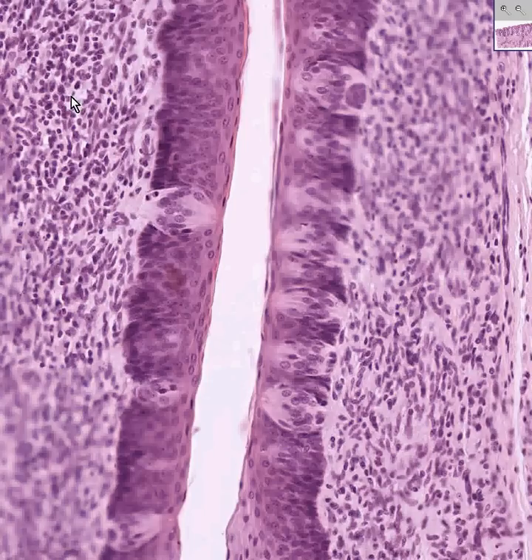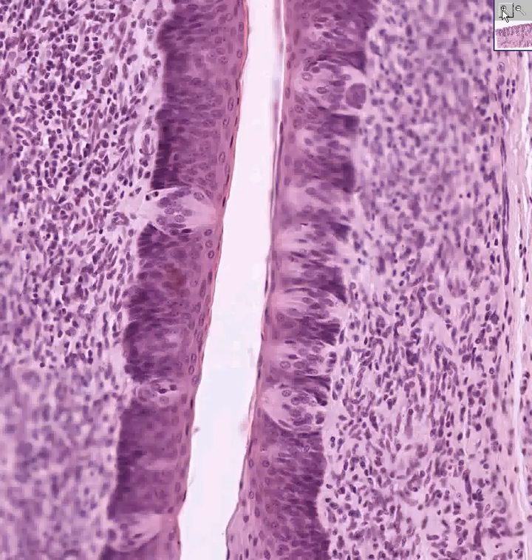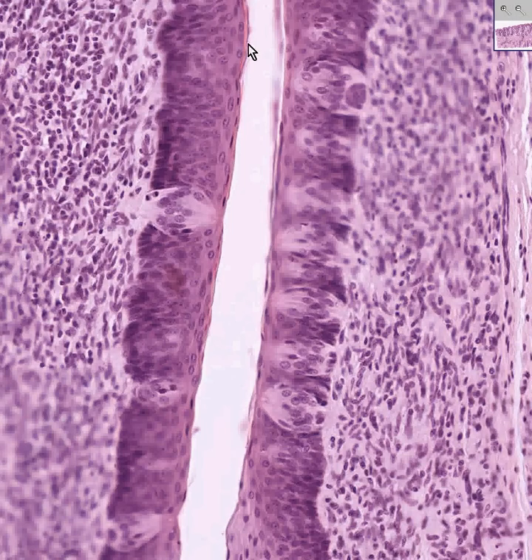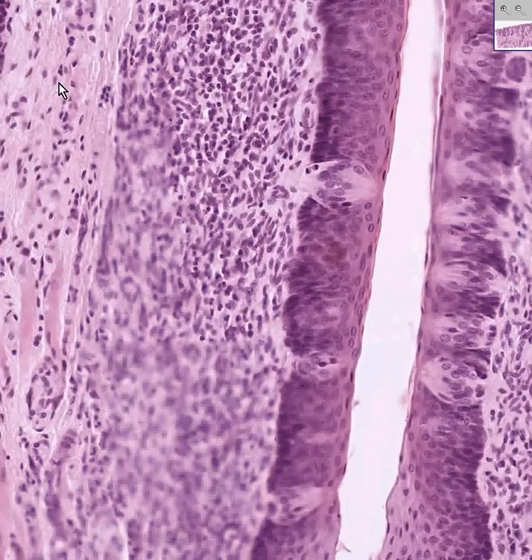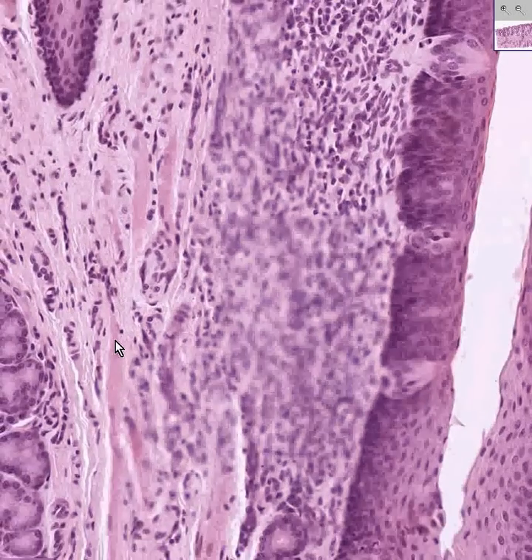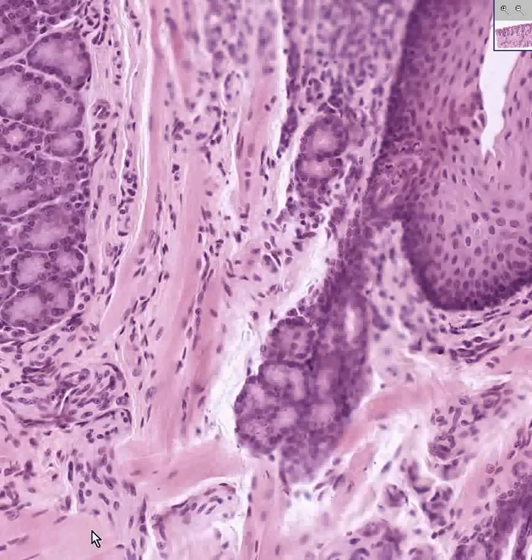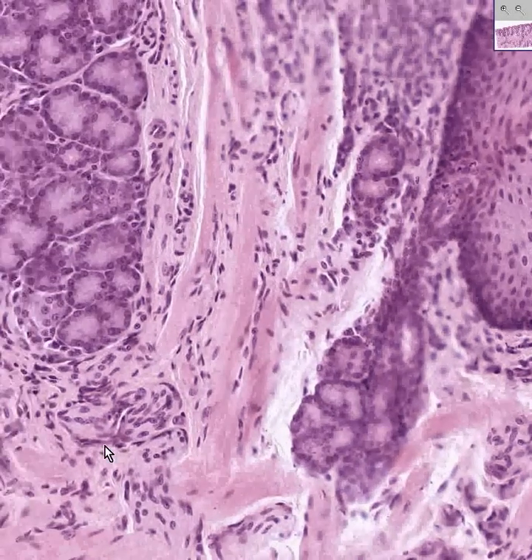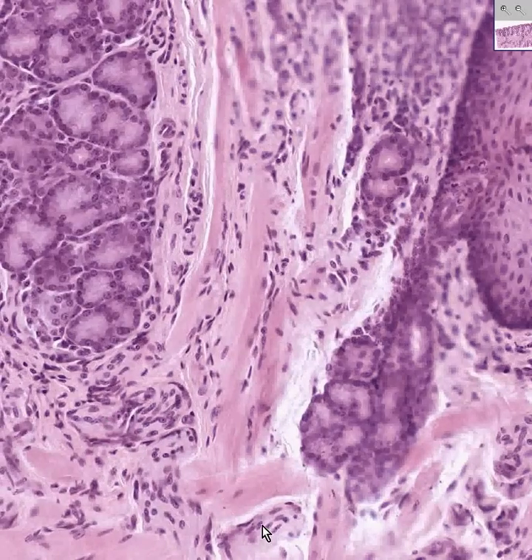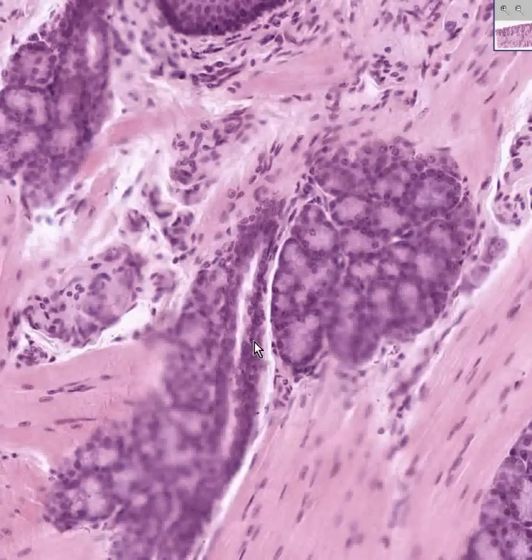Here's some lamina propria connective tissue — it looks like there are fibroblasts and lymphocytes, perhaps mucosal-associated lymphoid tissue or MALT, perhaps some plasma cells and macrophages. In this area we have chiefly fibroblasts or loose connective tissue, but here we're starting to get some skeletal muscle fibers coming in from the big skeletal muscle basis of the tongue. This could be either a compressed gland or maybe a nerve — this looks kind of like a nerve. And here are some more serous Ebner's glands and skeletal muscle fibers.